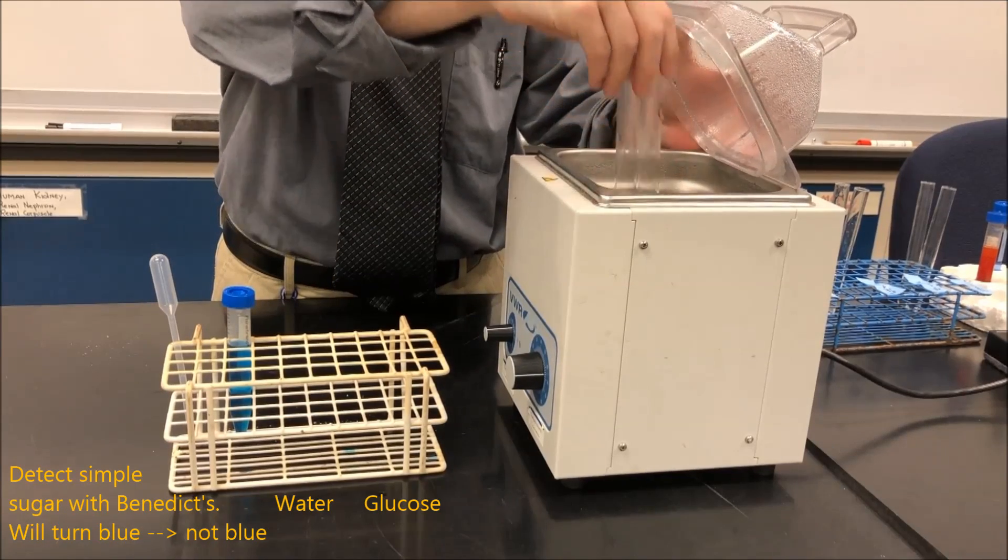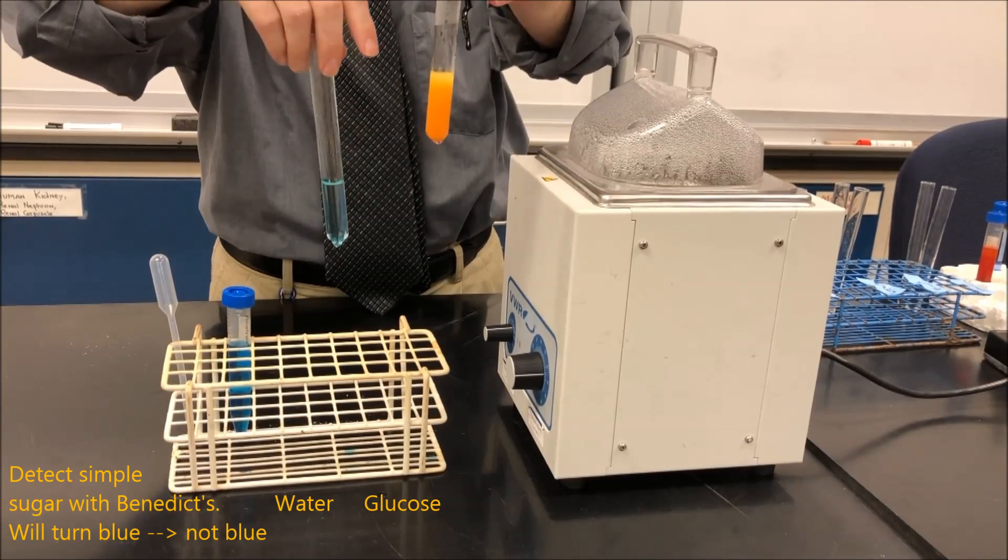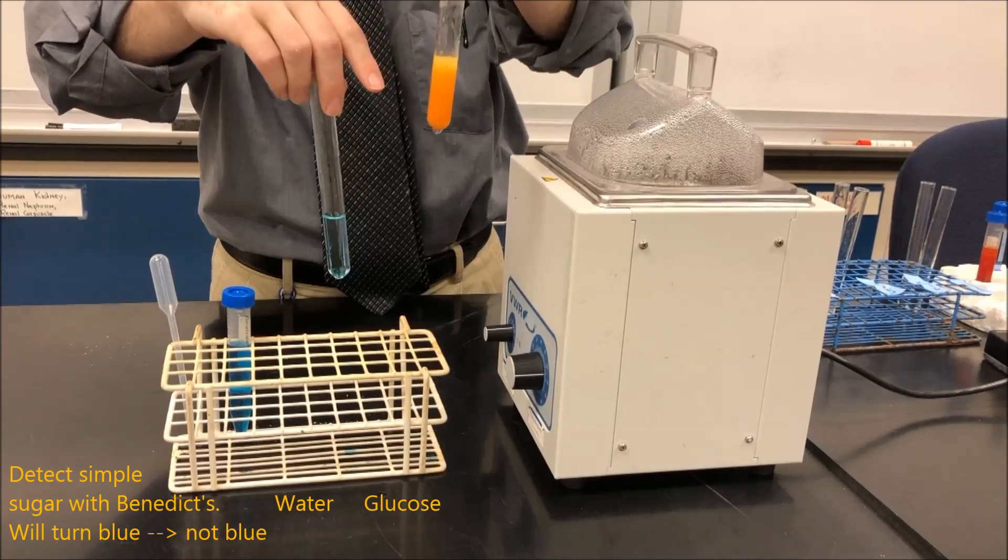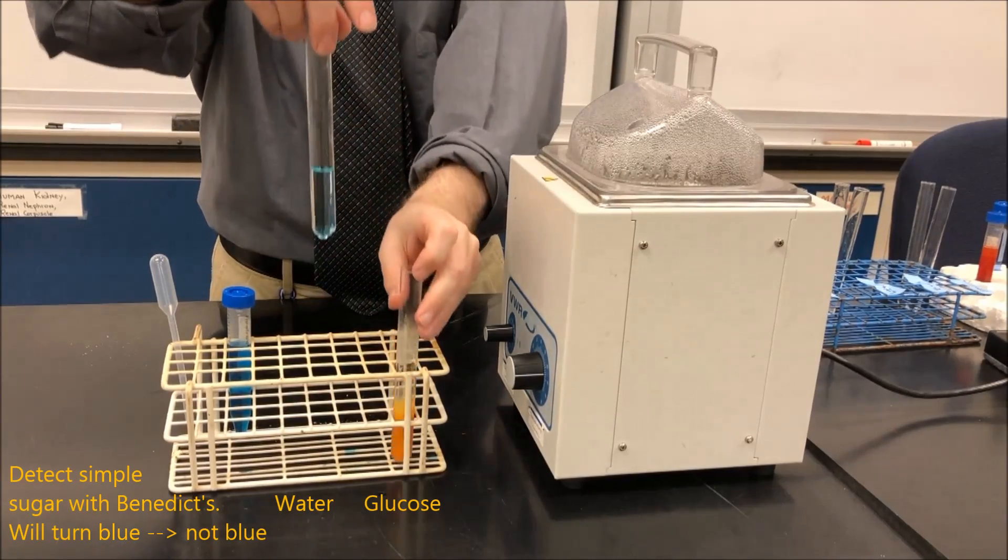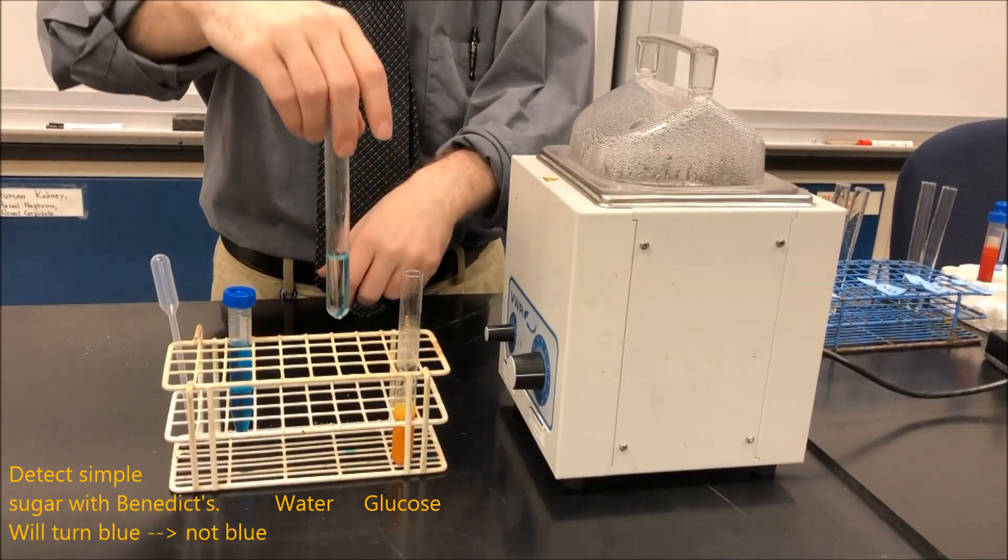So five minutes has gone by. And now if we take a look, we can see that the one that contained glucose went from a blue color to orange. So glucose is present. And in my control, it stayed blue. So no glucose is present.